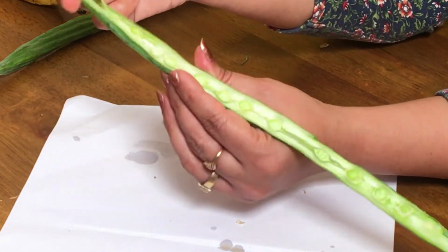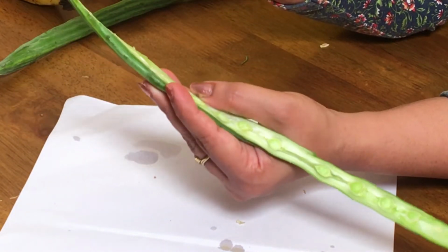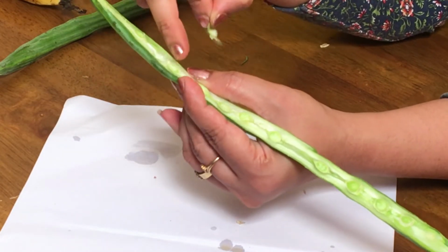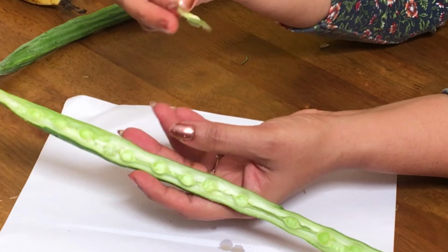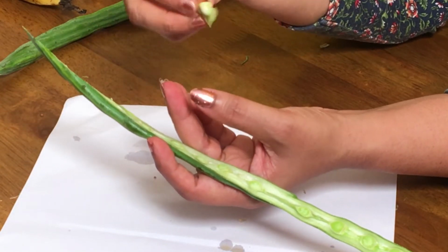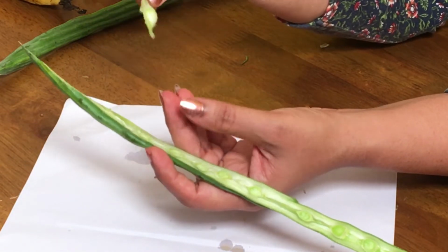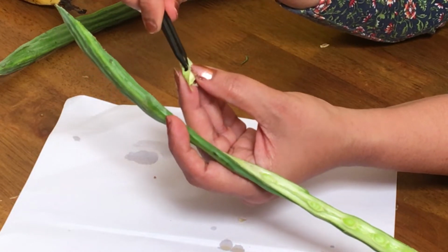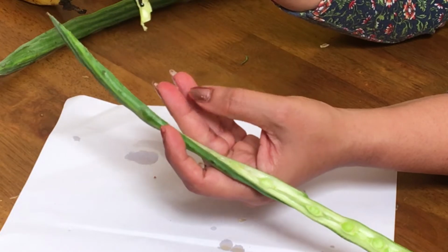Why? Because once the ovary is mature, once this fruit is mature, this pericarp will dry, they will burst open and release the seeds, and these seeds can be easily carried by the wind. So that is why it is having these kind of wings. These are the wings of the seed to make it lightweight.